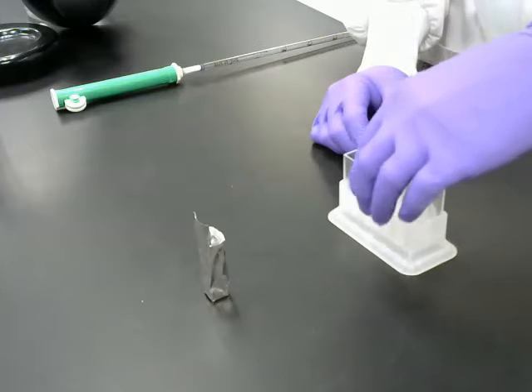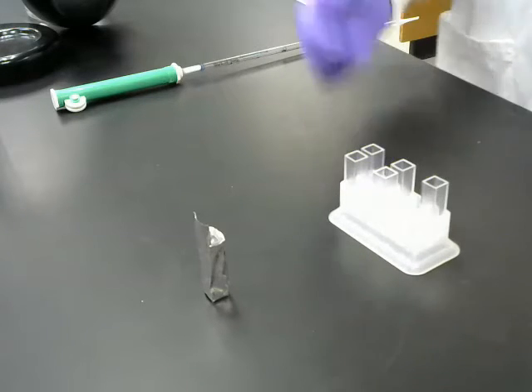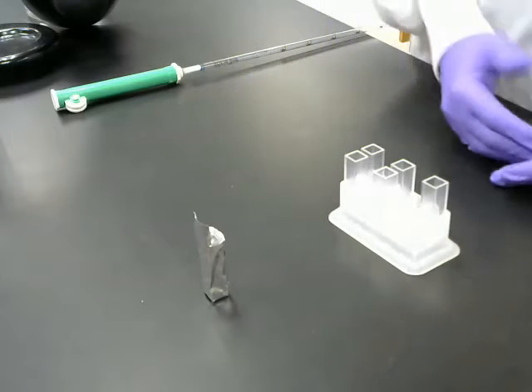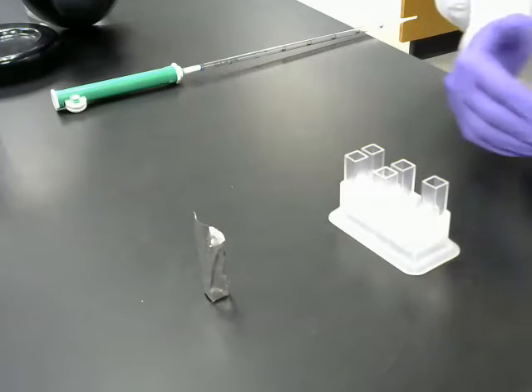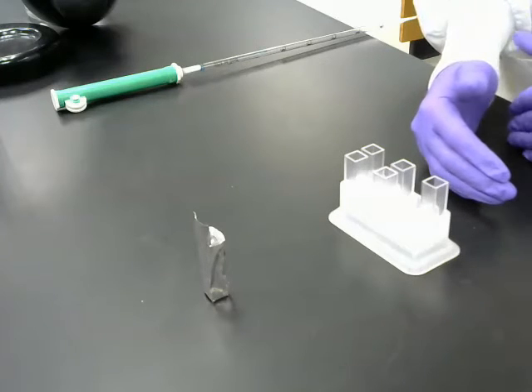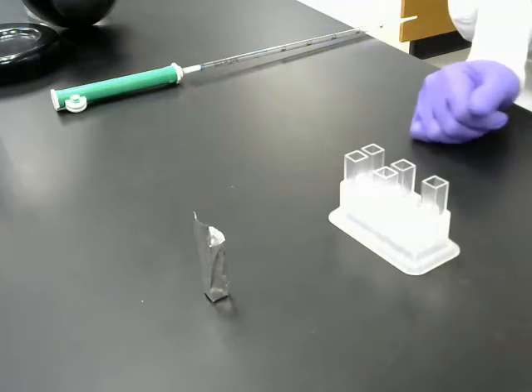Okay? The other control we're going to have is going to have no chloroplasts. Again, we know that photosynthesis can't occur without chloroplasts, so what's the purpose of that? Well, that's going to sit out in the light without chloroplasts, and that's kind of a check to make sure that light alone is not sufficient to interact with our buffers to reduce DPIP. Okay? So those are the functions of our two controls.